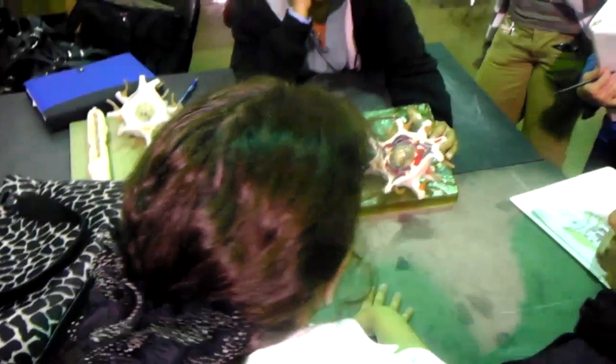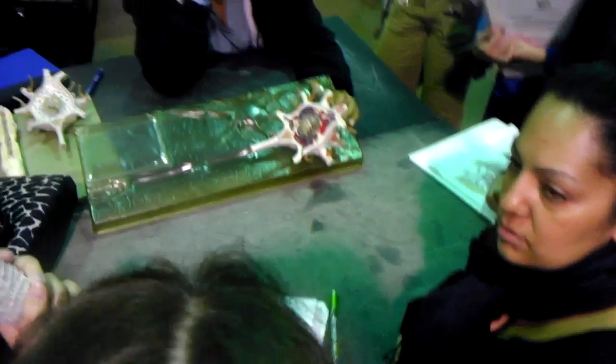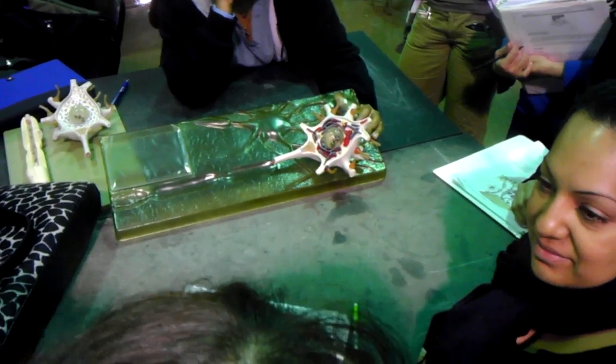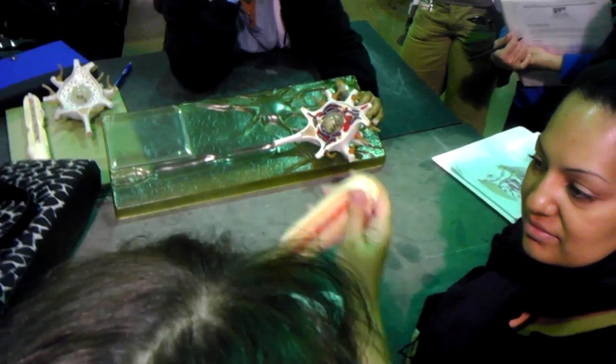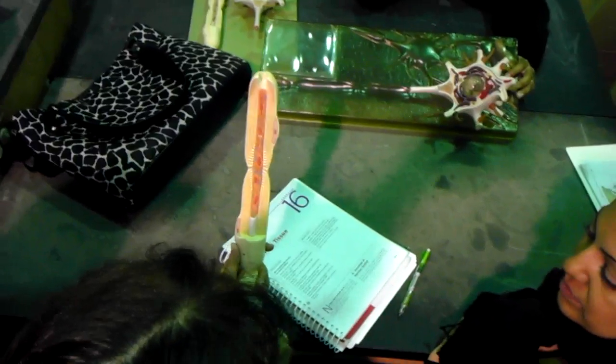What's that gray area around? Which one? That gray part at the bottom? It's the Schwann cell. The whole thing is the neuron. Around it is actually the membrane of the neuron. You can say that this is the axolemma, but don't worry about it because it's not exactly the axolemma. The axolemma should be somewhere around the axon.